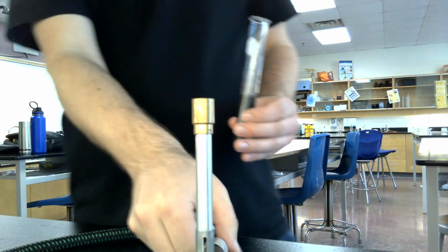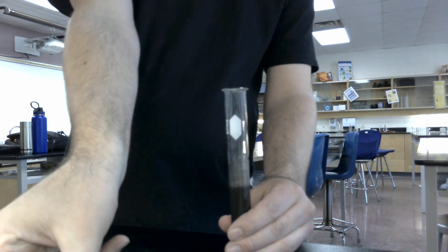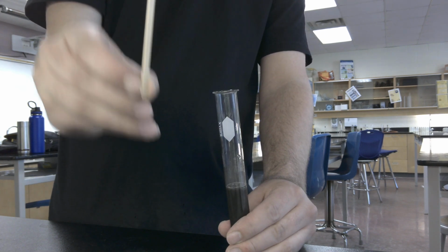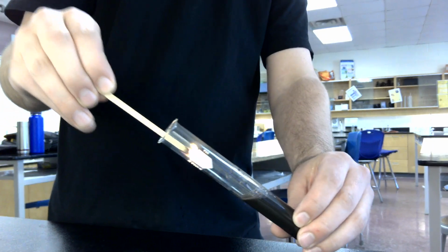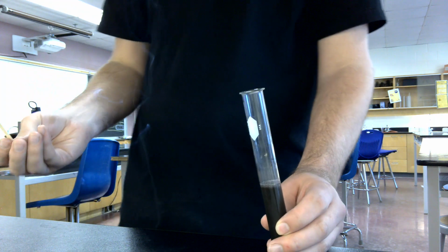What that indicates is that the gas we are producing as it bubbles is actually oxygen, because with our glowing splint, everything that we have here is ready for combustion. You've got the wood, you've got the fuel, you've got the heat. The only thing missing from this reaction is enough oxygen to actually let it catch on fire. And by bringing it in there, look at that, we can still do it. You can get it to burn. So that is the glowing splint test. Set that aside.